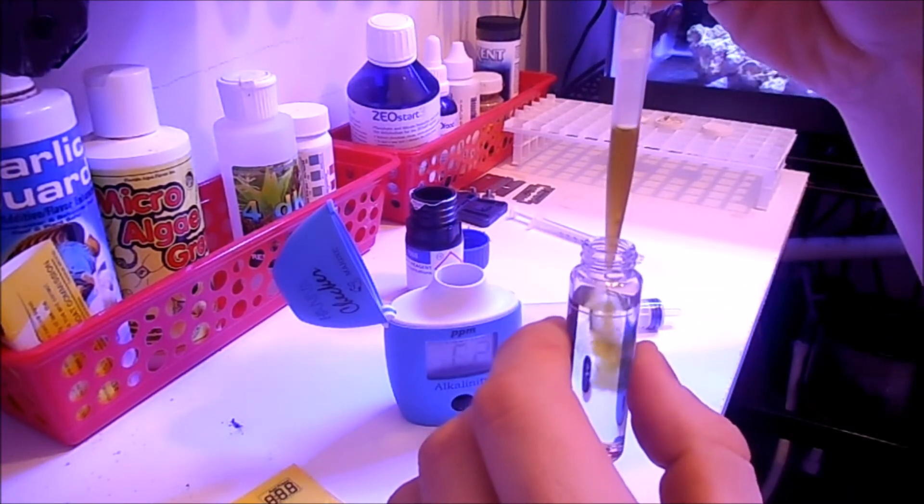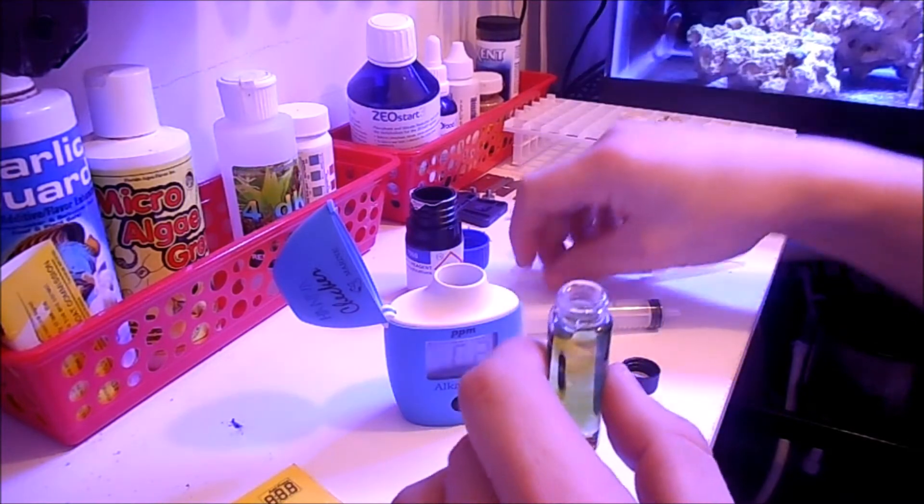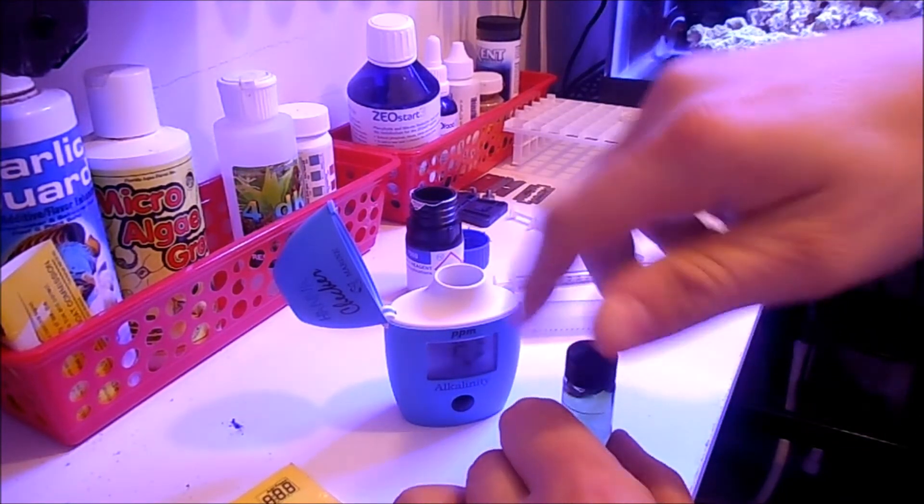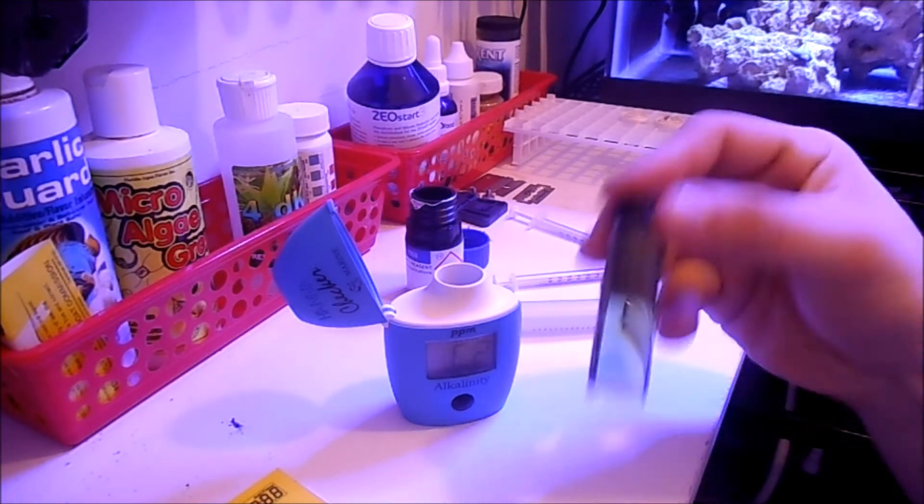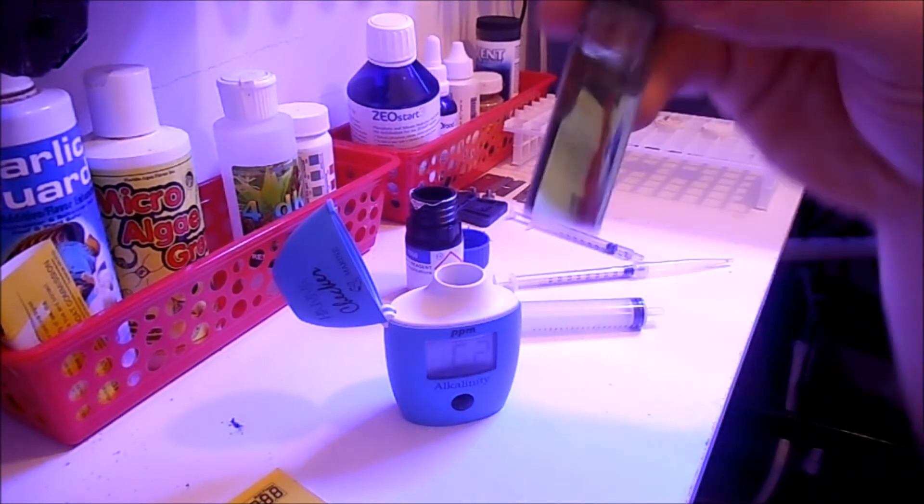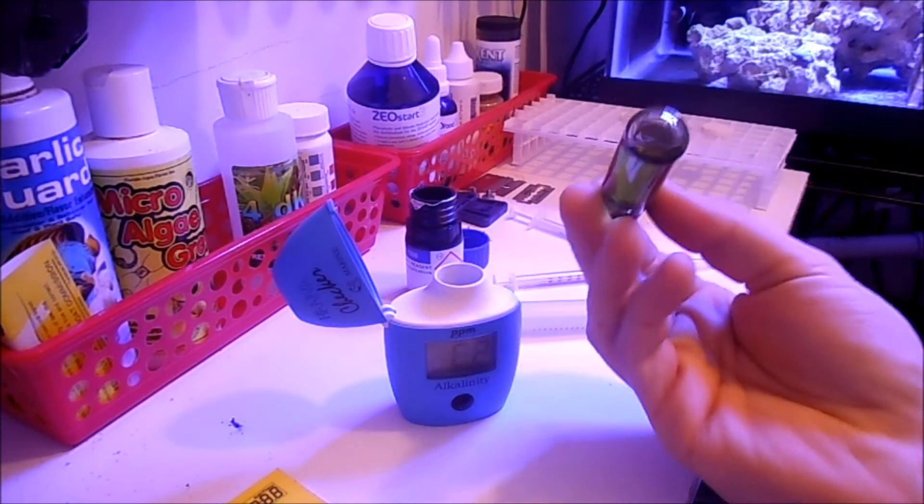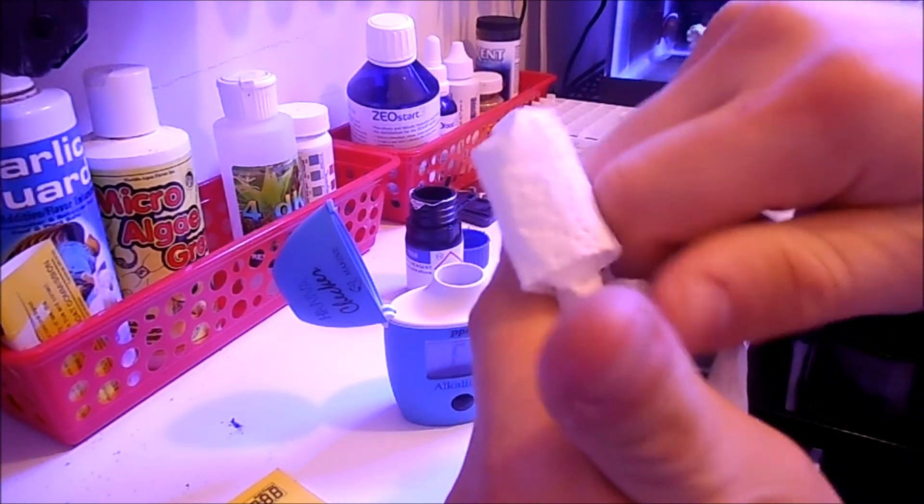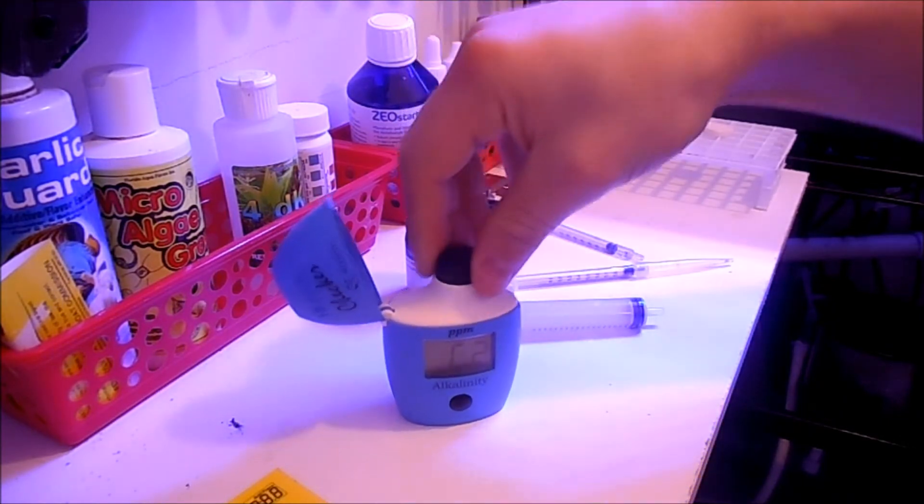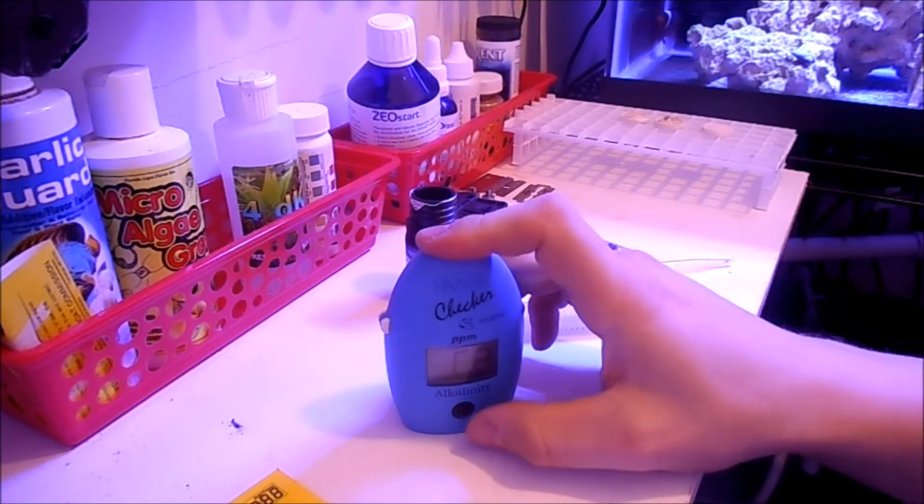And then just put that in here. Grab your paper towel here. They want you to shake it five times, four and five. I do that just in case you get fingerprints on it. Clean it off, and then hit the button again.